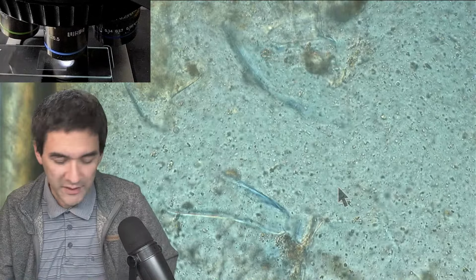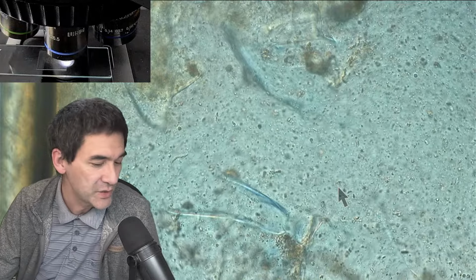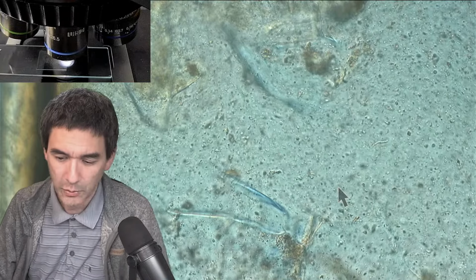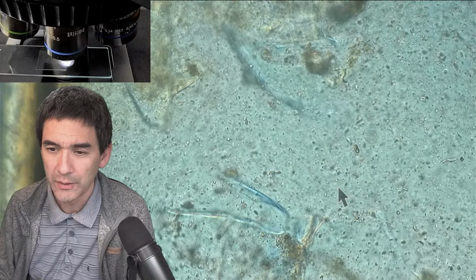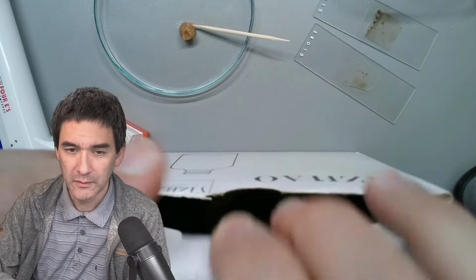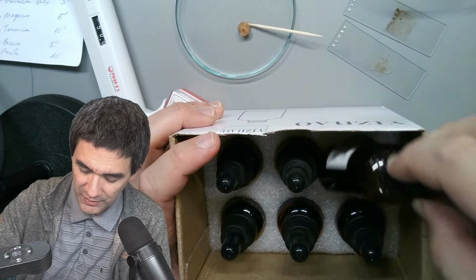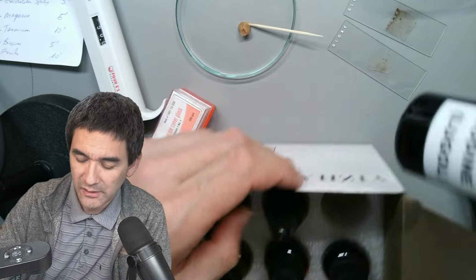However, what I want to do now is something that just came into my mind. Let me quickly grab my stains. Just a second. It's just over here. Here we go. I've got a whole collection, and I would like to stain now with iodine, for starch. Yeah. So let me see, where is this here? Look, I just want to show this to you here. There's a little bit of my stain collection. What is this here? I already got it here. By coincidence, iodine.